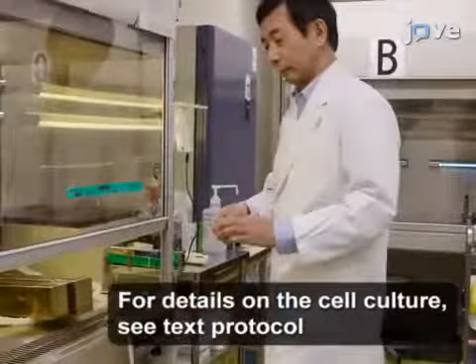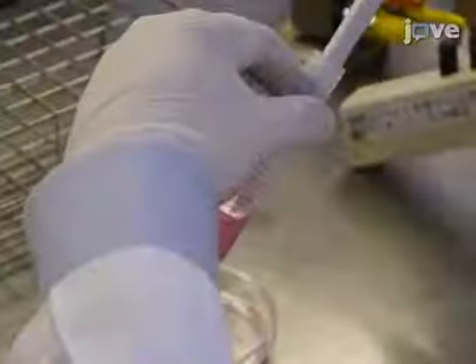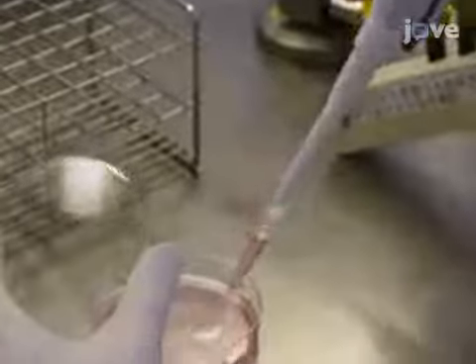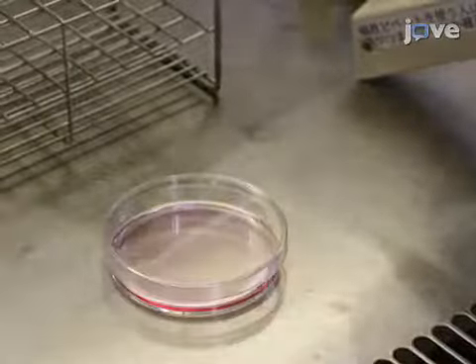To begin the induction of tetraploidy without the shake-off method, passage approximately 5 × 10⁵ cultured cells into a 100 mm dish. Incubate the dish in a 5% carbon dioxide atmosphere at 37 degrees Celsius for 24 hours.